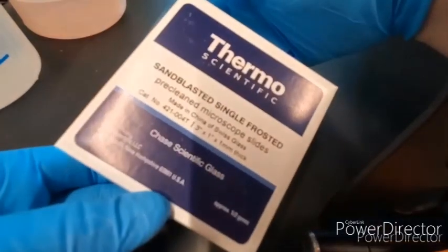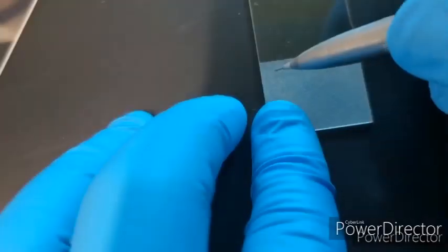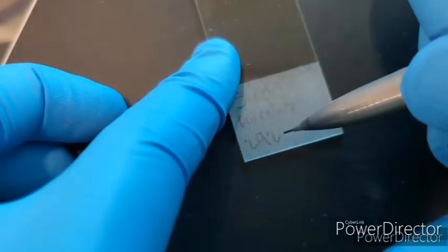So we have sandblasted slides to work with. I'm going to grab 2, one for each organism here. So we got to label the slide with 2 patient identifiers, or just 2 identifiers is a good habit for QC as well, to truly know what you're working with.